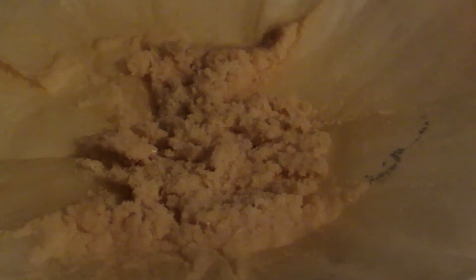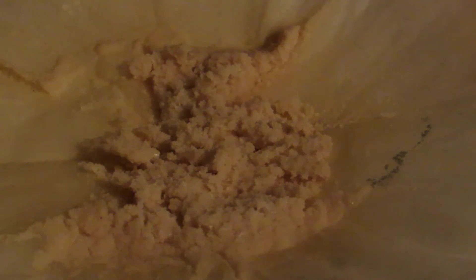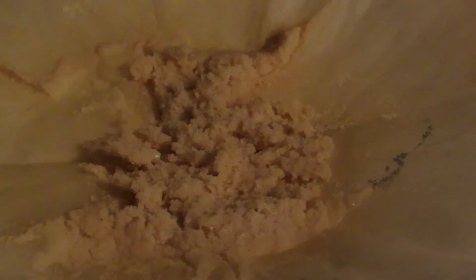Okay, so after filtering off, I just put it on some paper towel to help absorb some of that methanol and let the rest evaporate away. My camera makes it look slightly pink, but in reality they look very white with just maybe a slight offset of color. A third recrystallization using water could be done if necessary if you needed to obtain super pure results, but for what I'm going to be using this for, which is making nitrous oxide or dinitrogen monoxide, this is fine purity. Anyhow, I'll let this finish up drying and then we'll weigh it and see exactly how much we got.